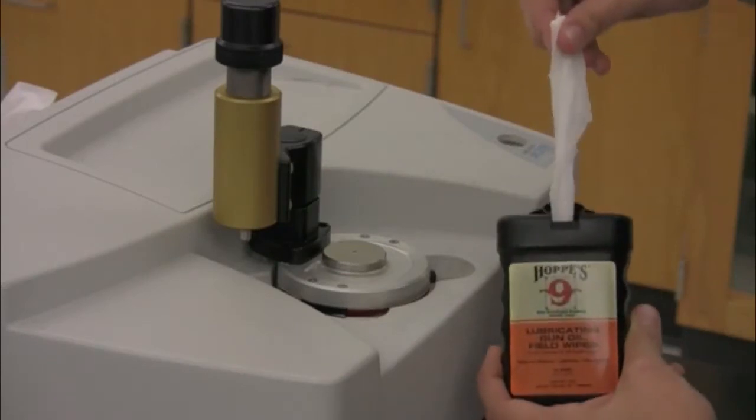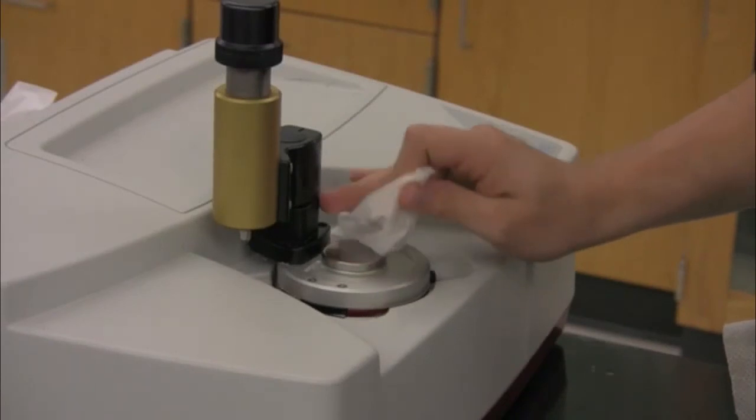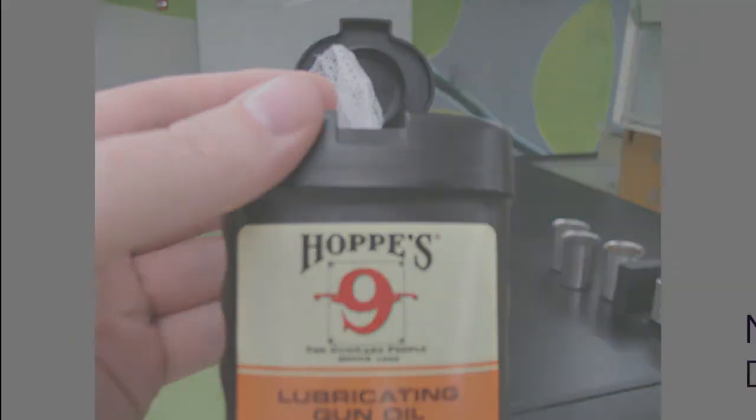If a diamond is hard to clean and it has material stuck on it, and you've tried with a Kim wipe and you've tried with a microspatula like an ice scraper, then you want to go find a TA. We do have special Kim wipes in the lab that the TAs can use that have an oil on them that will dissolve materials that are stuck to the diamond. But only the TAs can use these special cloths to clean the diamond. So once the diamond is clean and your IR spectrum has been cleared from the window, don't forget to take your USB key with you, and we're ready to have the next person go on.